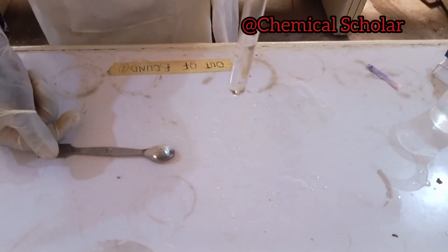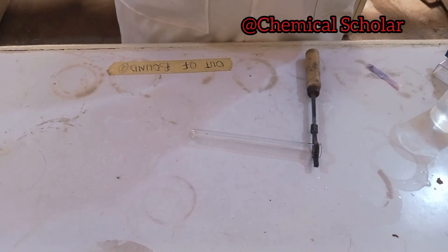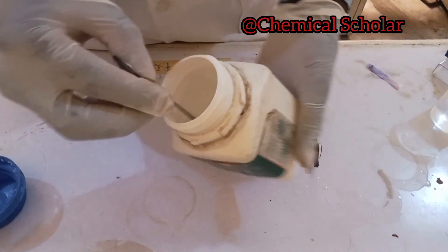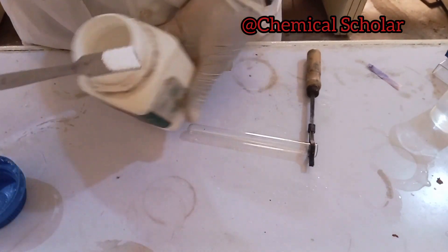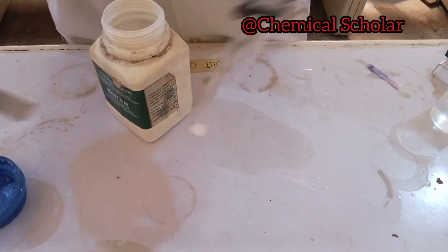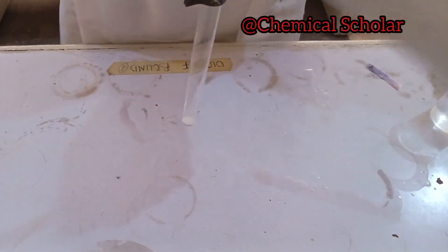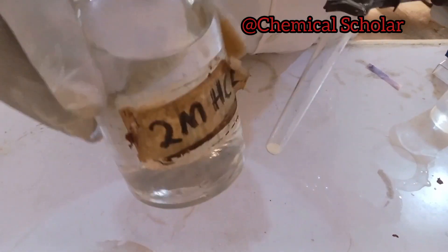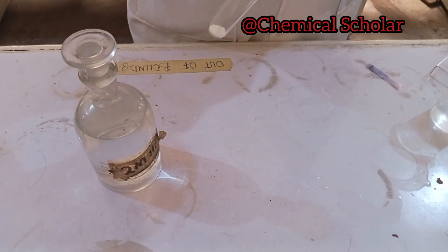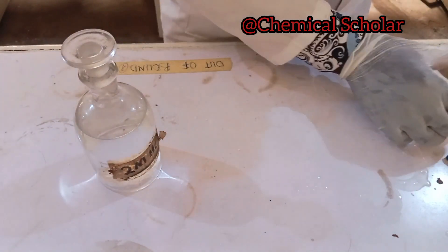CO₃²⁻ ion is confirmed — if it were any other ion, it would not dissolve in dilute HCl. Another test we are going to carry out is on the raw solid sample of the salt, not the solution. We will add dilute HCl directly to the solid. If the gas coming out is CO₂ from CO₃²⁻, reacting the salt directly with dilute HCl will produce a very large effervescence, liberating CO₂ gas.